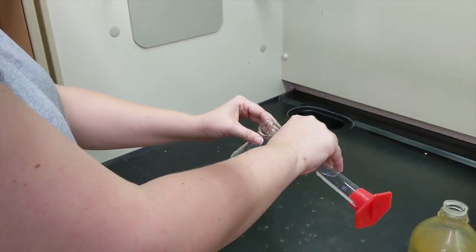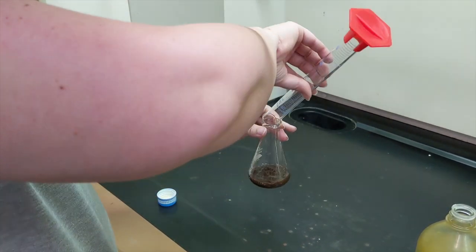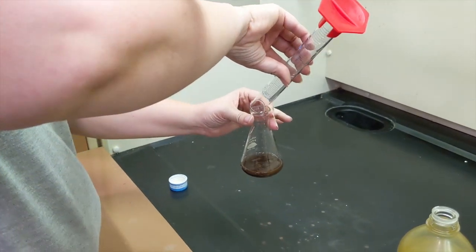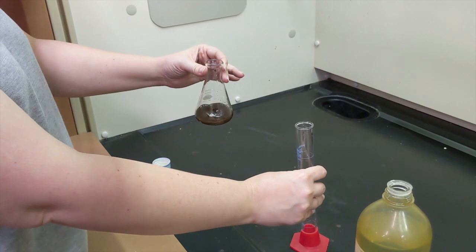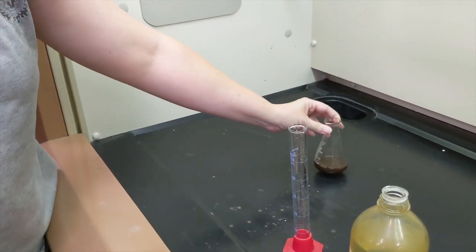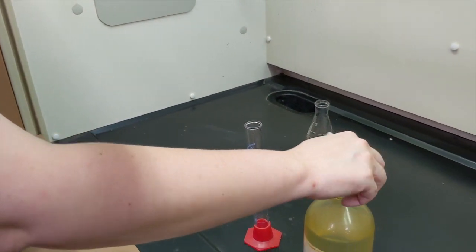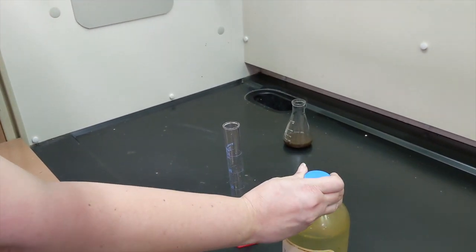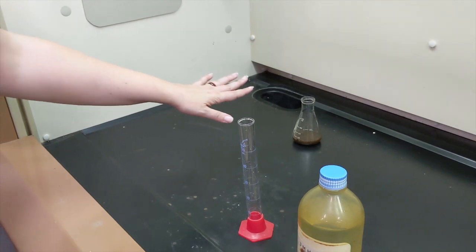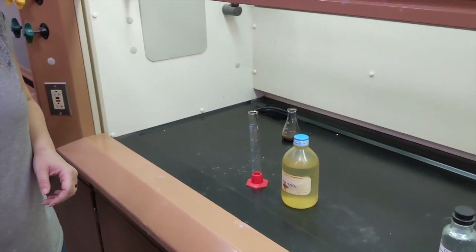I'm going to add this to my iron. Swirl a little to mix. And then I'm going to set it back in the back here. We're going to make some fairly stinky sulfur-containing compounds as this reaction happens, and I don't want to smell them. This is less a safety concern than it is a comfort concern if we're being honest.